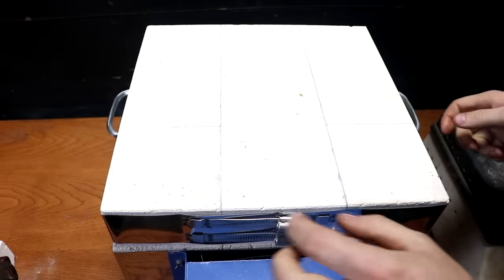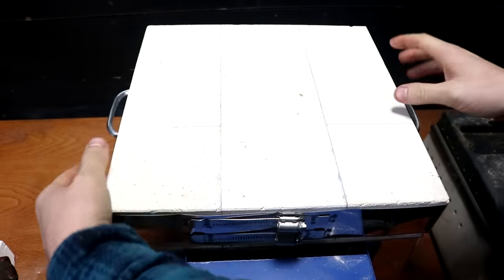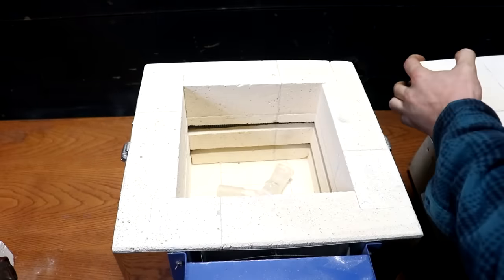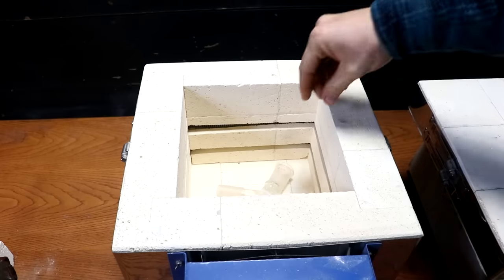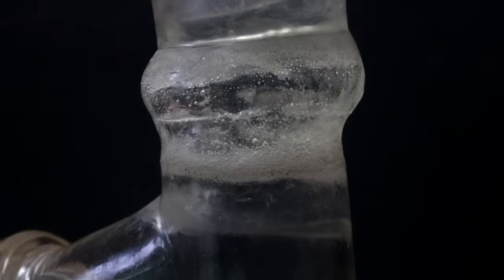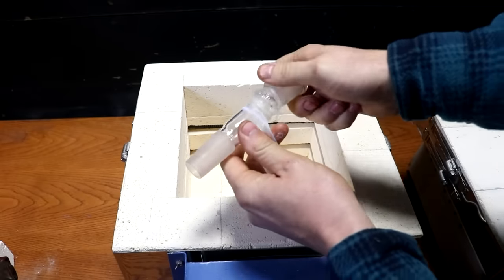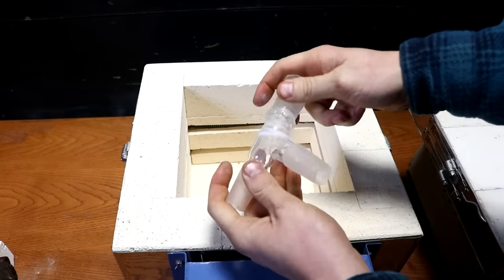Okay, moment of truth. It's been about 12 hours. I just let this cool down naturally. And these fire brick are pretty insulating, so it took hours and hours to cool. But it's down to room temperature now. And here we are. It doesn't look like it's cracked. It's pretty good. It's got some white powder on there. I wonder what that is.